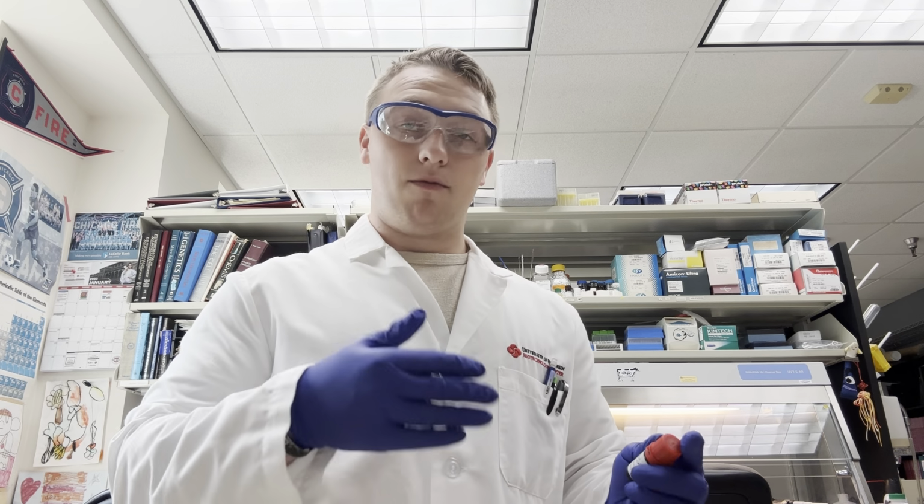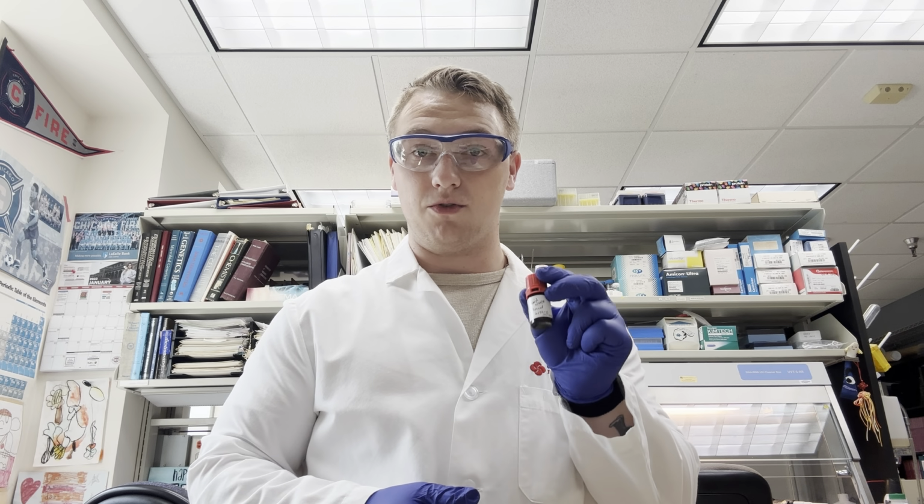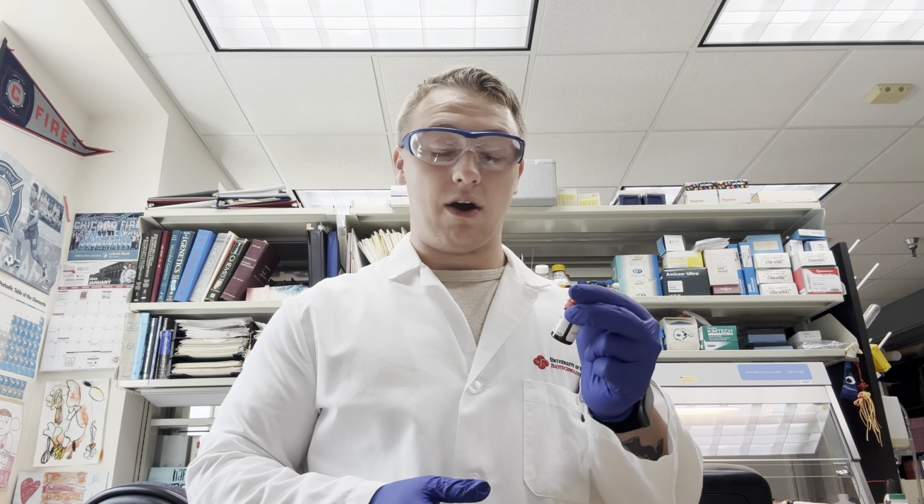So in order to do that, specifically for the liquid chromatography instruments, we need to get whatever sample we are analyzing into a liquid state. And in order to do that, we obviously need a solvent. But first and foremost, we're going to determine whatever sample it is we are trying to dissolve in a solvent, that which we want to analyze.